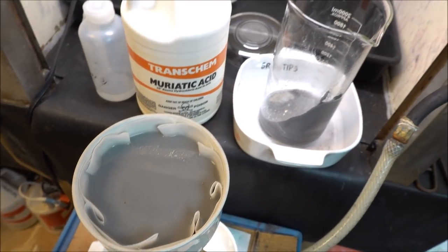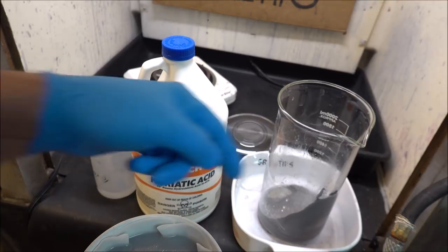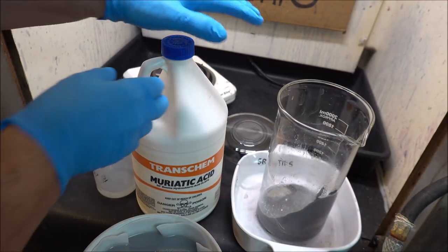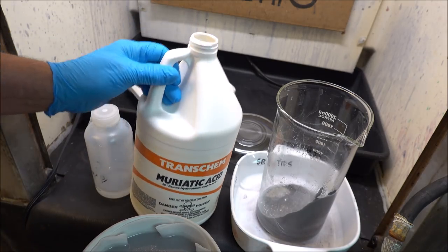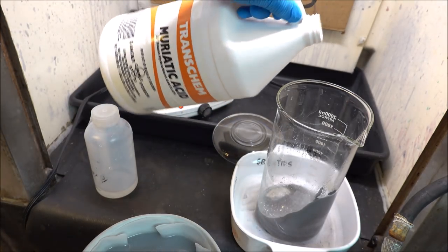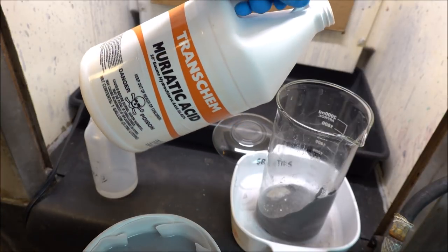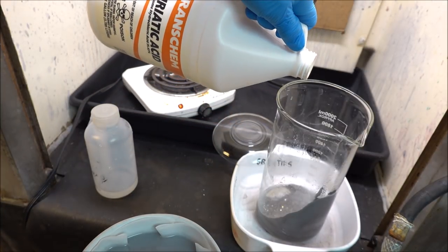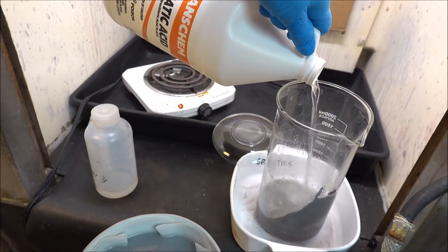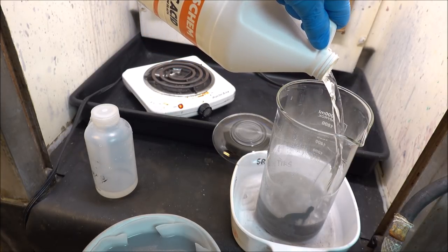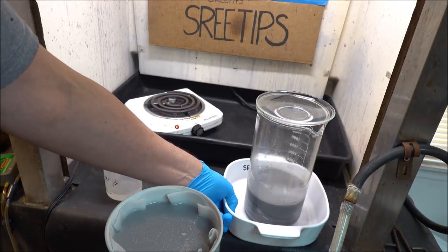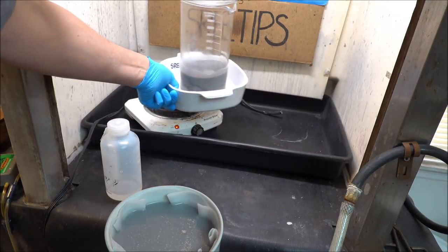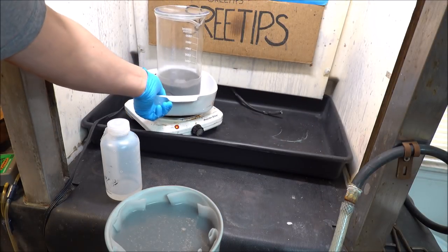I've got most of the liquid off of the material in the beaker. I'm making this up as I go, as usual. I've never done this before, never worked with this kind of material. I'm adding hydrochloric acid to the beaker here.